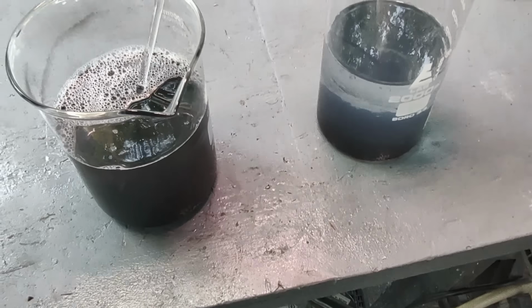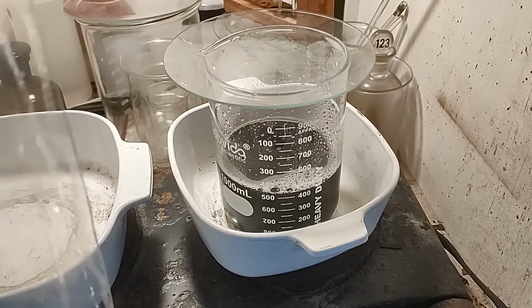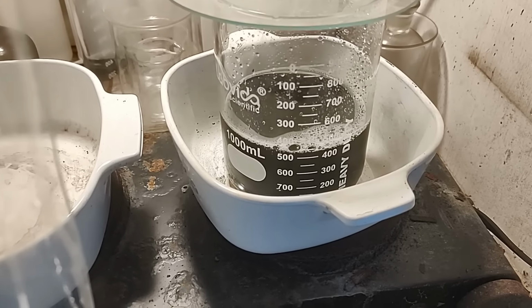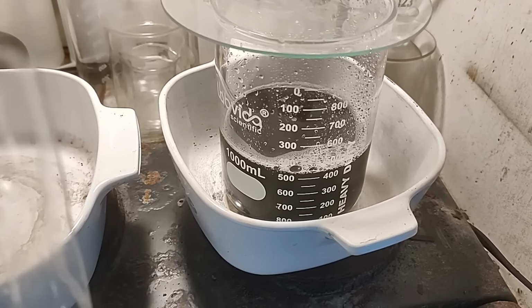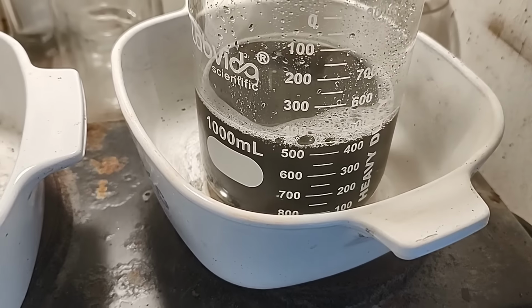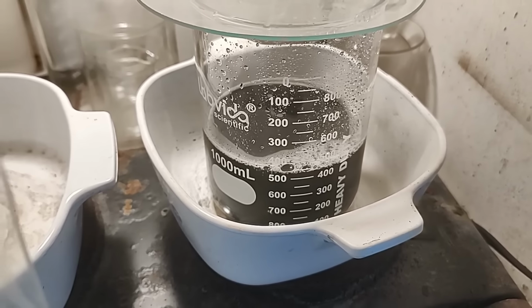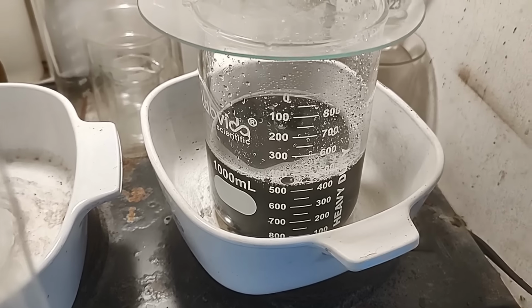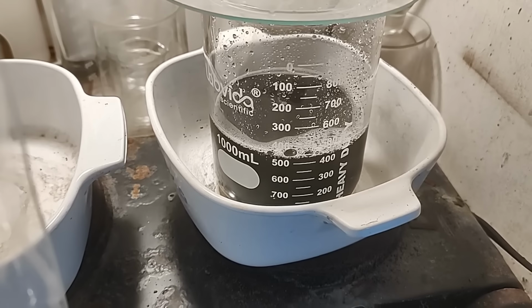Alright, getting close to the end. Finally, getting close to the end. Alright, I have decanted the liquid off of the palladium in those two big beakers and transferred the palladium into this smaller beaker and put about half a liter of distilled water on it. Gonna give this a boil. You can see that it's gone turbid from transferring the palladium over, so there's some fine stuff in there. I'm hoping that with these boils it will consolidate better once we get rid of the ammonium formate residue and anything else that's in there. So I'm hoping, we'll see.